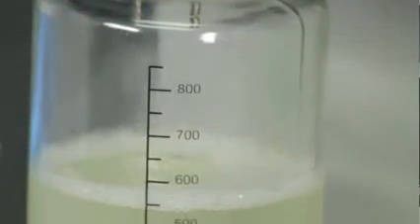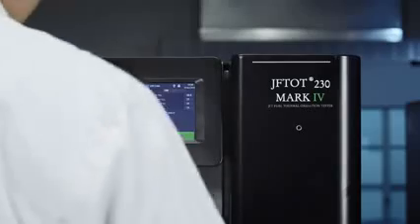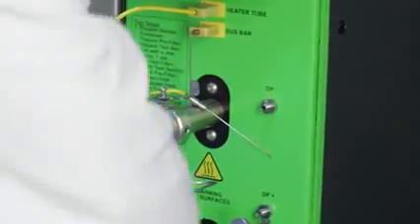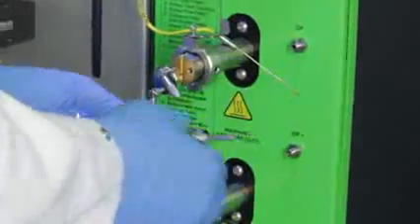When the test is done, you can rate the heater tube. Let the heater tube section cool, and then remove the heater tube and rate the deposit as specified by the standard you use.